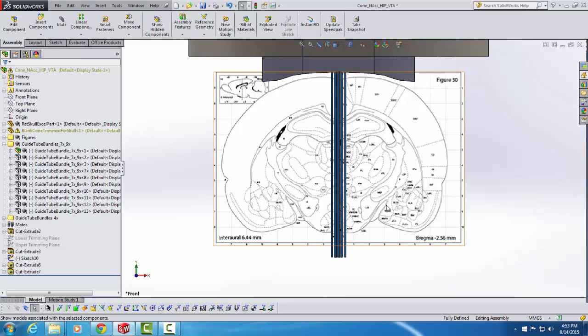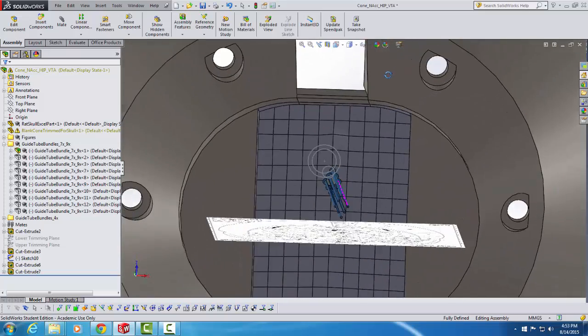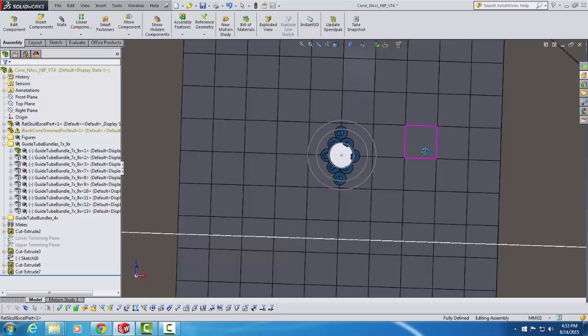Now to get a better view of what's going on here, we can look from the underside. And what you can see is that there is a bundle of 9 probes that are shaped in a diamond shape, and the center one is not visible because it's occluded by this hole at bregma. But this bundle is centered exactly upon bregma when it appears, and we're going to move it relative to bregma, so bregma will be our starting point. Now we need to move this bundle posteriorly into the plane that we want to target, and then also laterally over to target the part of the hippocampus that we're interested in.